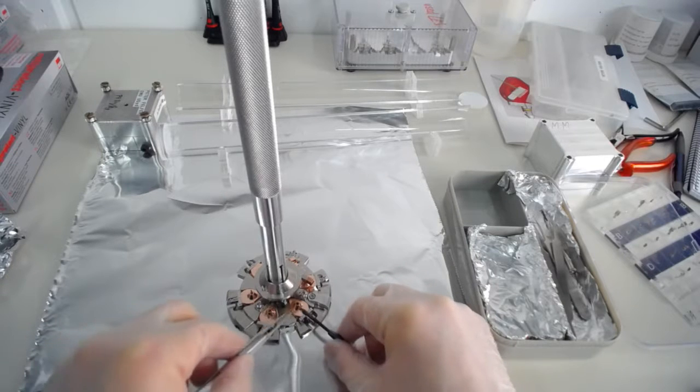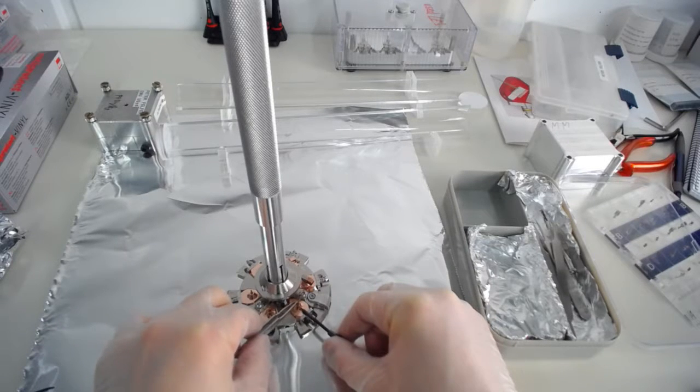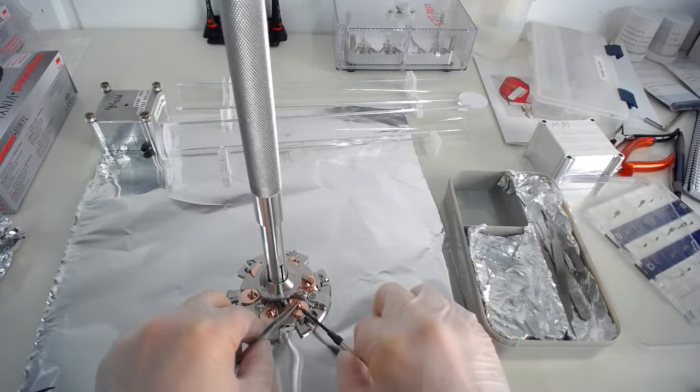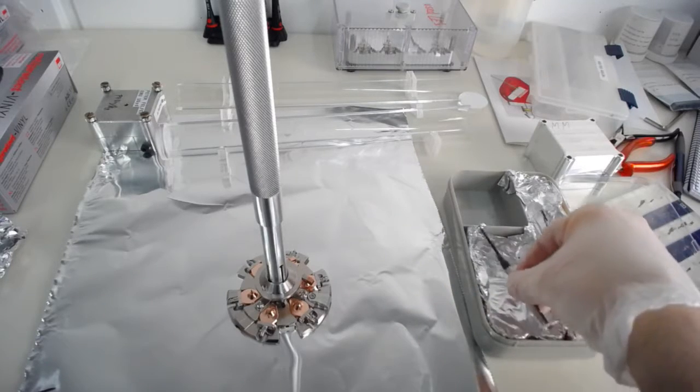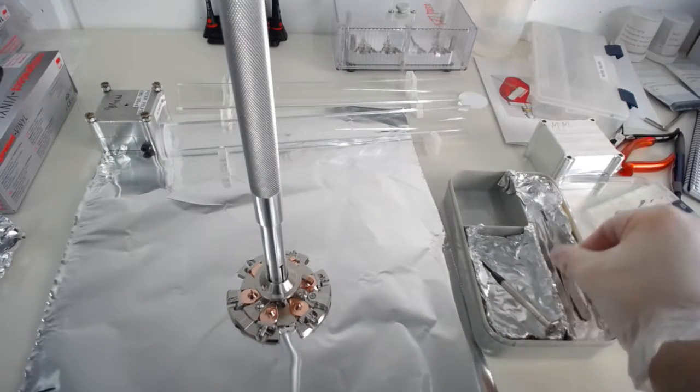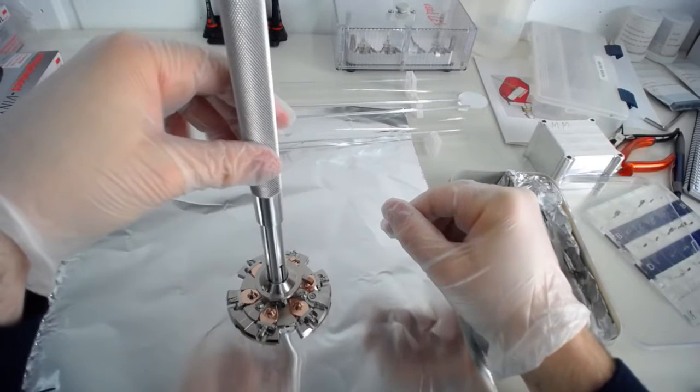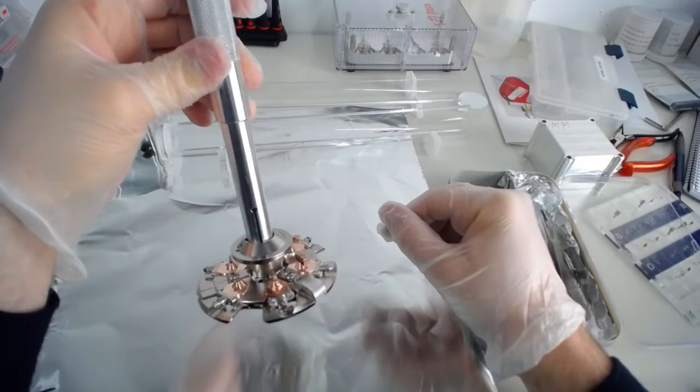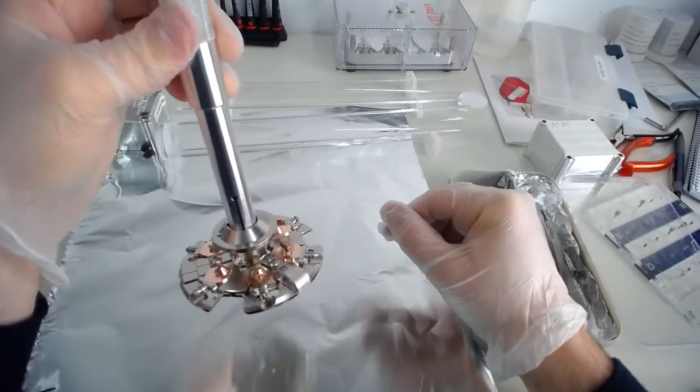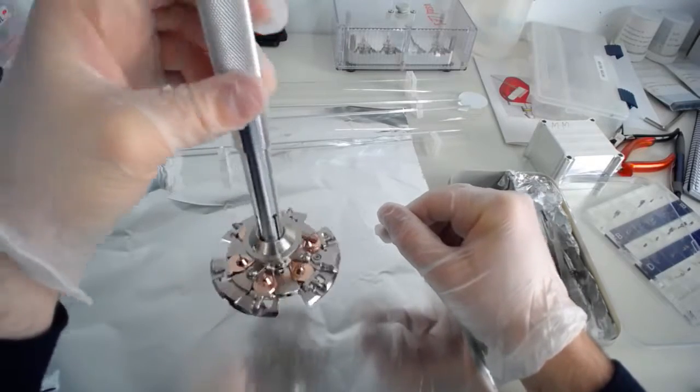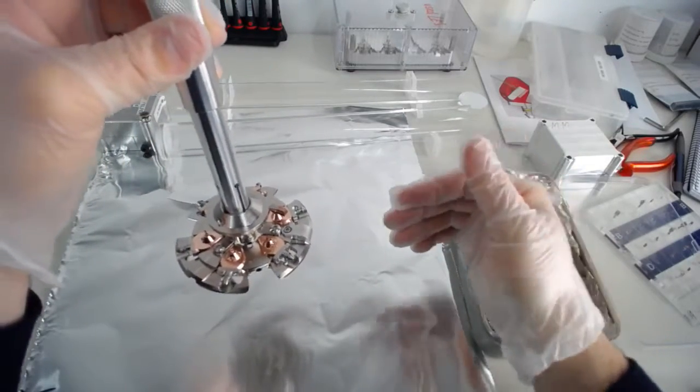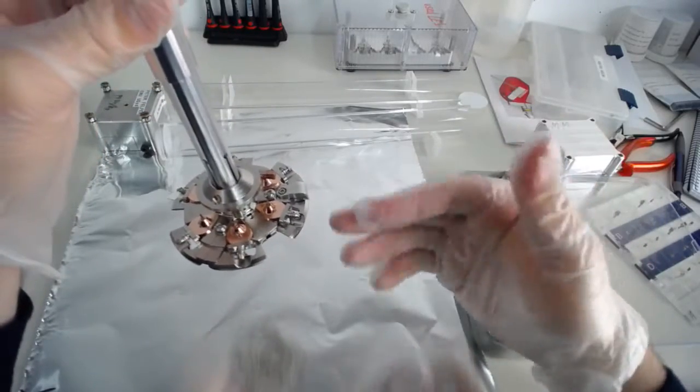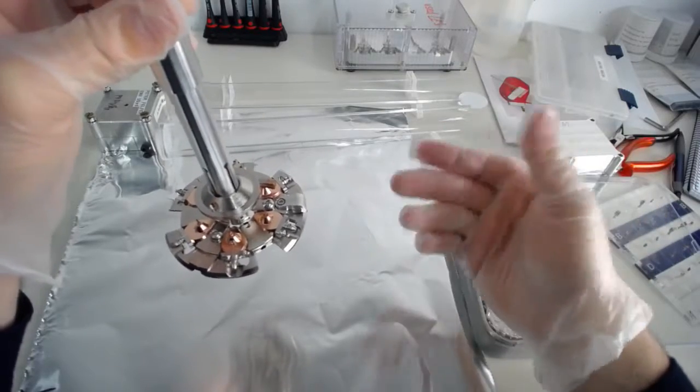It's an important thing. And also remember again, if you've got long hair, tie up your long hair. Put it in, and then just thumb and index finger, and not more. And then you would have your sample in, and it would be ready to go into the atom probe. So that's it so far for putting your sample into the carousel. Of course, if you do that, you need to check which carousels are free. If there's an empty one, you can put it into the empty one. All the pucks have numbers, so you need to remember what number you put it in.